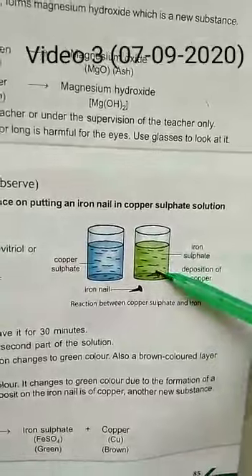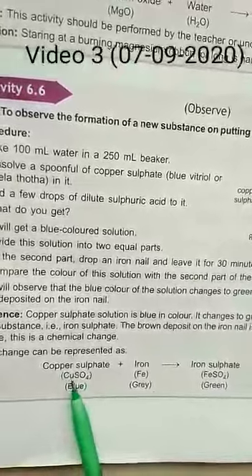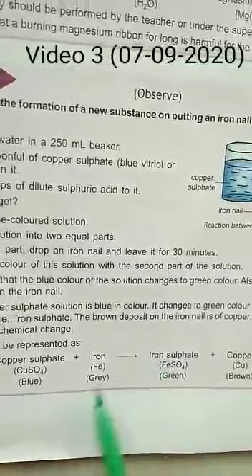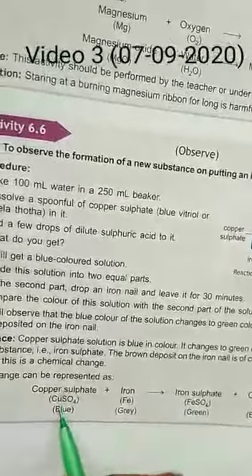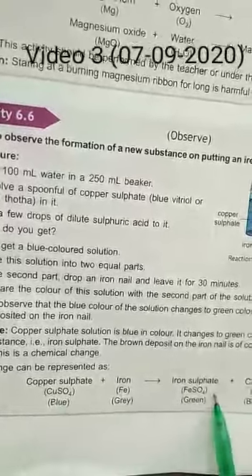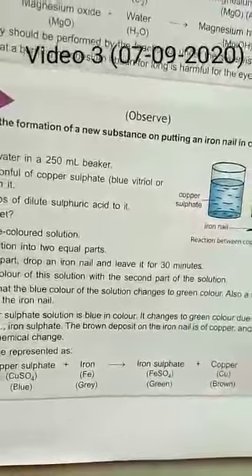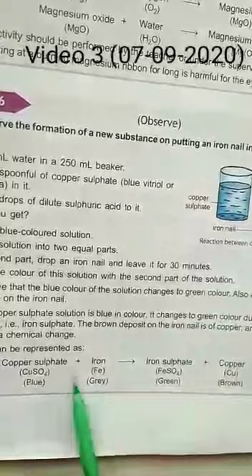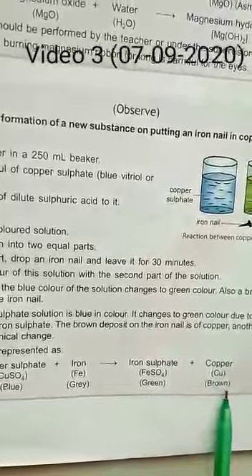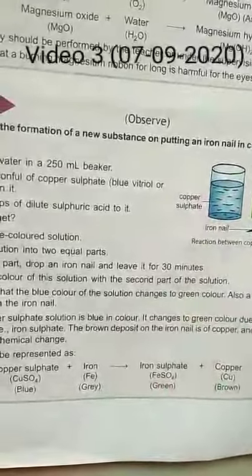Copper sulfate (CuSO₄), which is blue in color, reacts with iron (Fe), which is gray, and converts into FeSO₄ — iron sulfate, which is green in color. Iron takes the place of copper, forming FeSO₄, while the copper is left out as a brown deposit. You get a green color solution, and all of this demonstrates a chemical change.